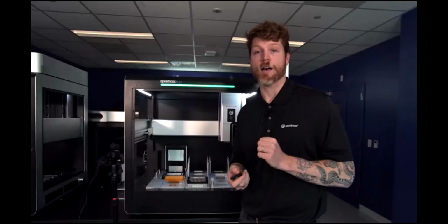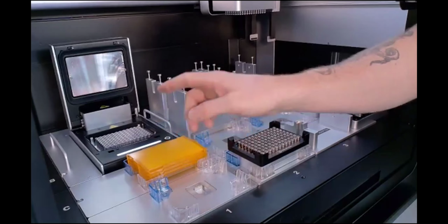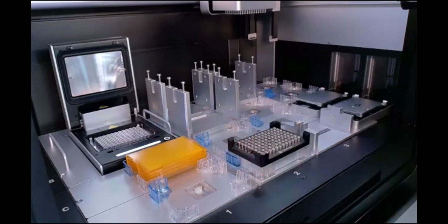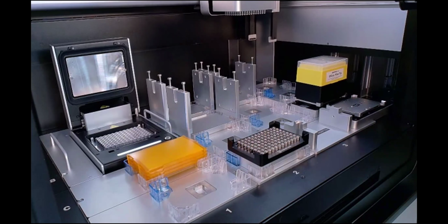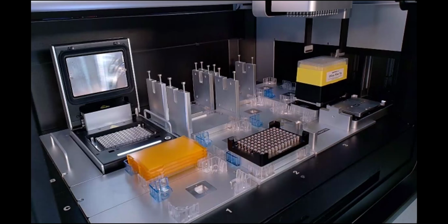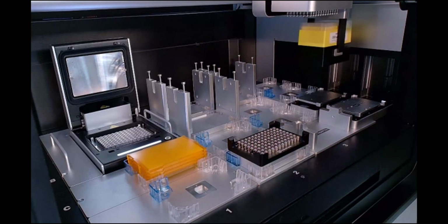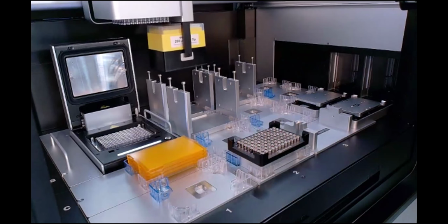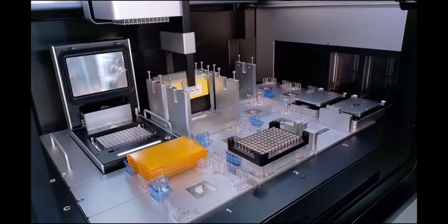The third thing that we have are also these new auto sealing plate lids, which you can see over here in the orange. These can be fully integrated into your automated protocol as they are compatible with the on-deck thermocycler and the flex gripper. These lids seal tightly once pressed down by the thermocycler lid, minimizing any contamination risk as you are cycling multiple times in a protocol. And very importantly, make sure that you don't lose any sample via evaporation during long protocols, such as the one that Matt had just shown off.